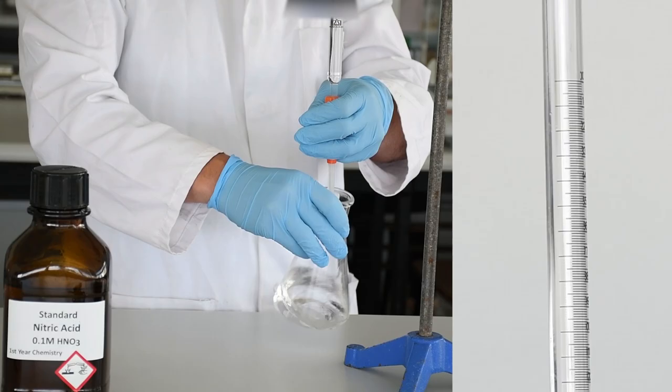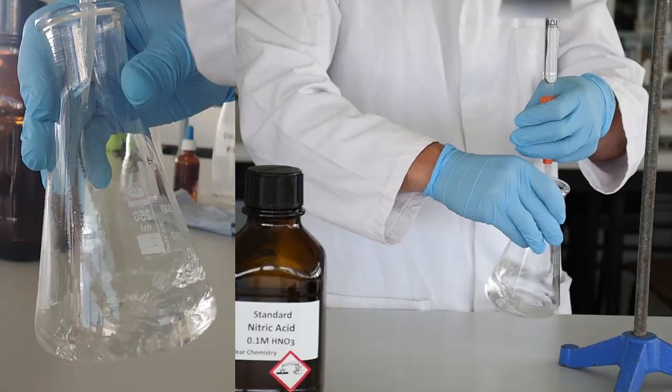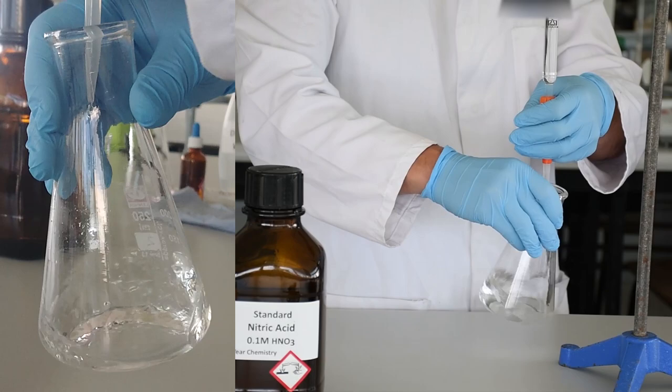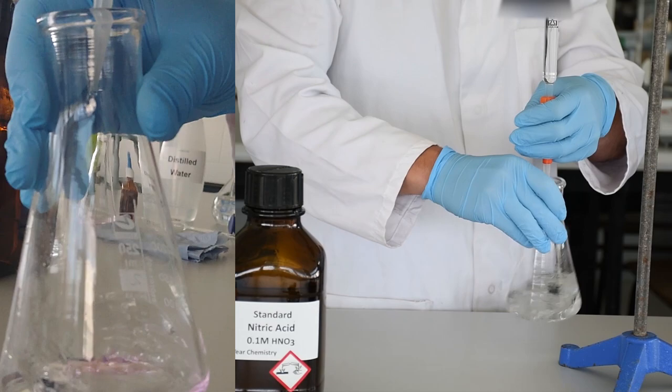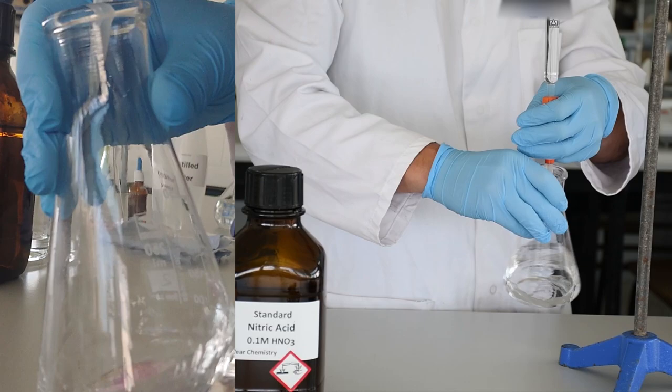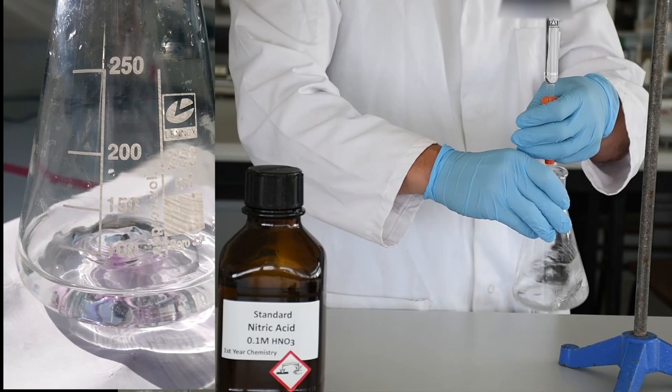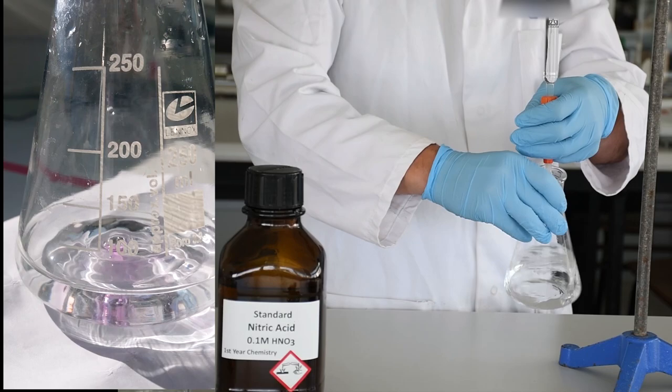On the left, I've slowed it right down time-wise, and you can see that it's possible to make single drops come out of the end of the burette. One of those drops is enough when you get to the endpoint to make the difference between colorless and pink. The other thing I want you to notice is that sometimes small drops can splash back up again. A drop can splash back up against the side of the flask, and those are enough to throw off your titration since we're down to the 100 microliter level of accuracy.